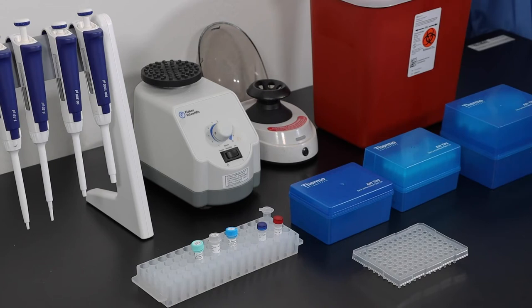In this video, we will show you how to perform PCR on the samples you have prepared. Once sample extraction is complete, you can move on to the PCR.